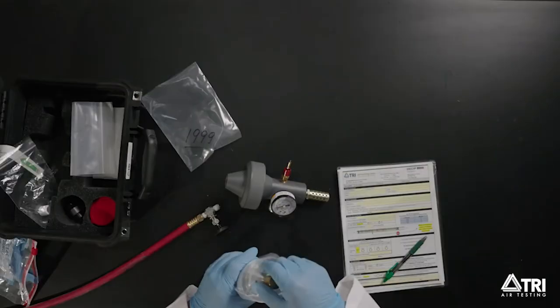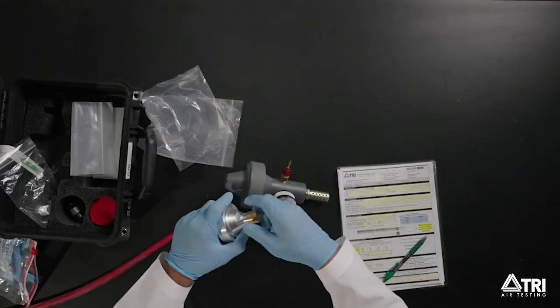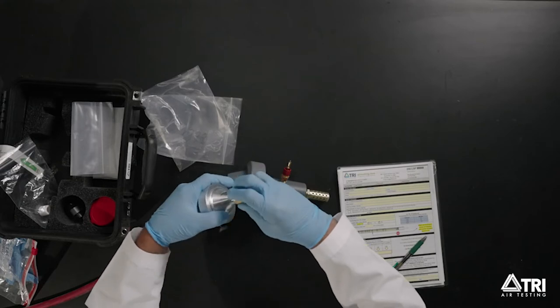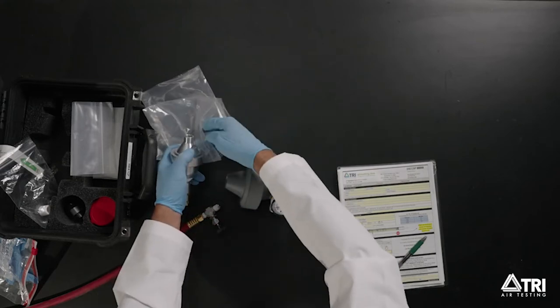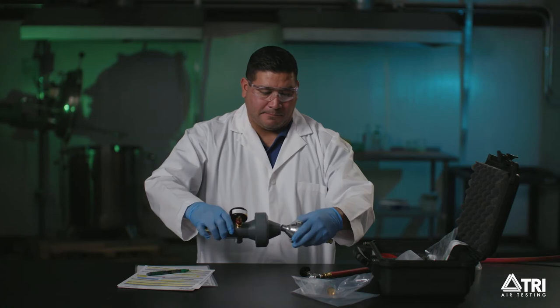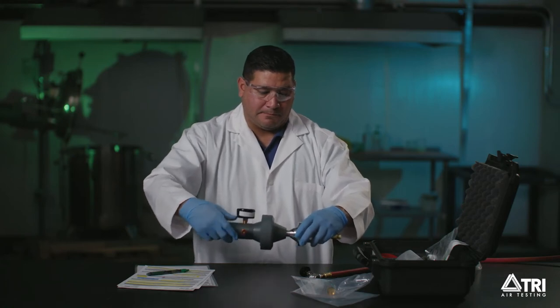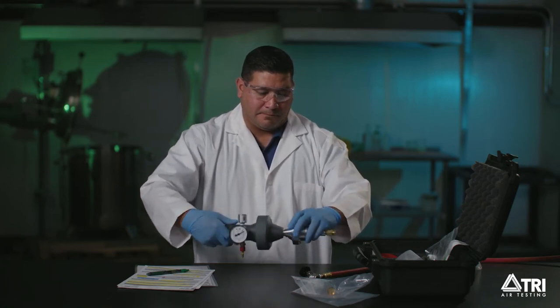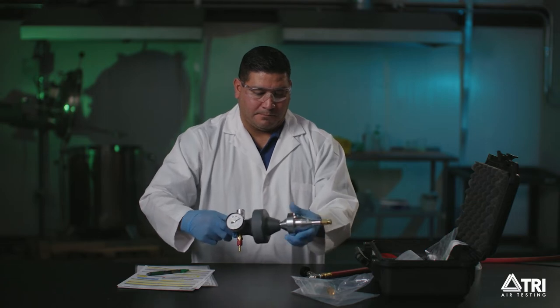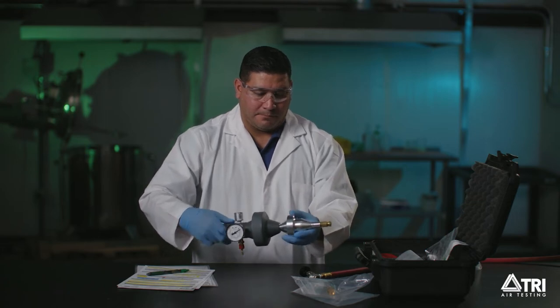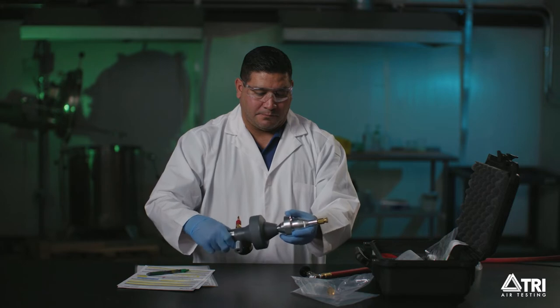Remove the assembled filter union from the plastic bags. Then remove the plug from the larger input and place it back into the plastic bag. Then connect the union to the PVC flow section. Do not unscrew the filter union. If you are sampling from more than one location, there is a separate filter union for each sample to help avoid contamination.